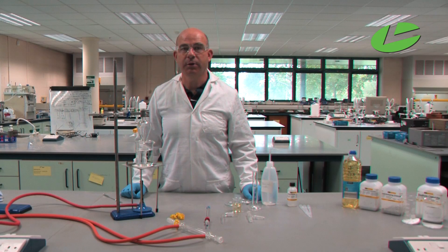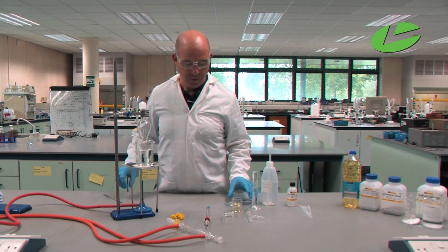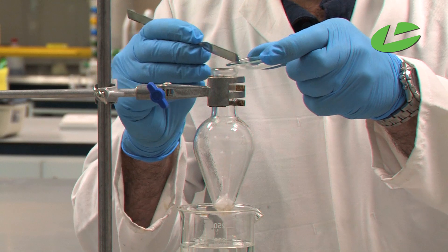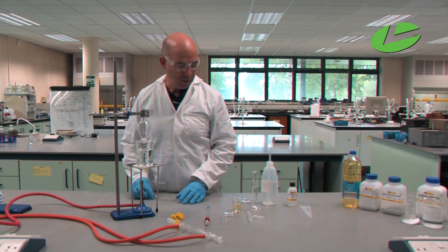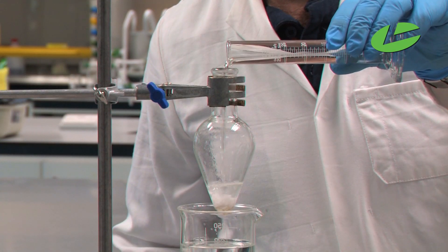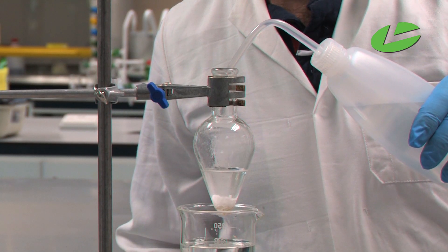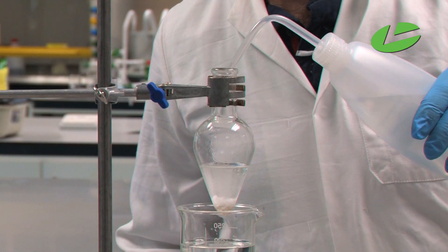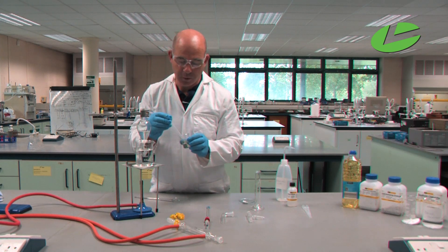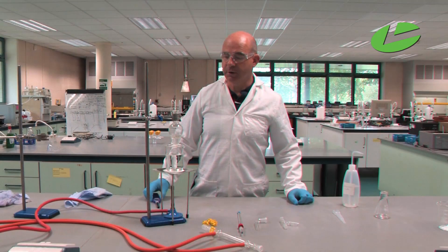I will start the procedure by placing the chemicals into the pear-shaped flask. First we add a few granules of anti-bumping granules, followed by potassium hydroxide, previously weighed out at two and a half grams. Next I'm going to add 20 milliliters of ethanol, and also a few milliliters of deionized water to ensure the reaction vessel doesn't dry out during the distillation.